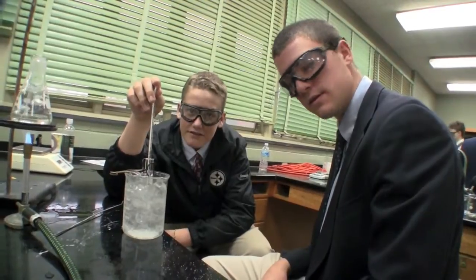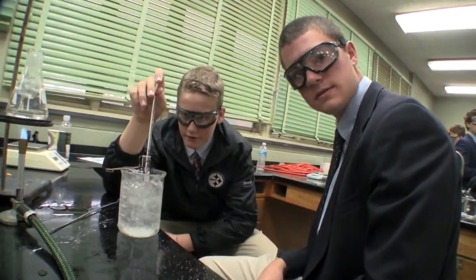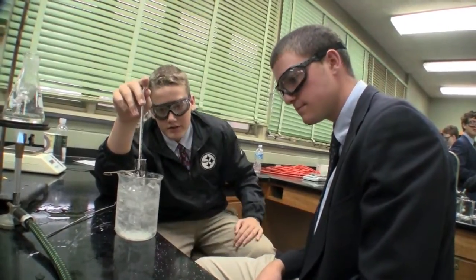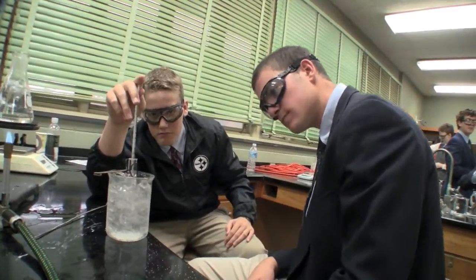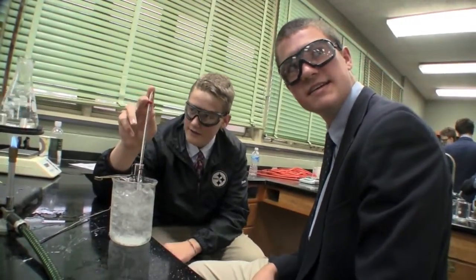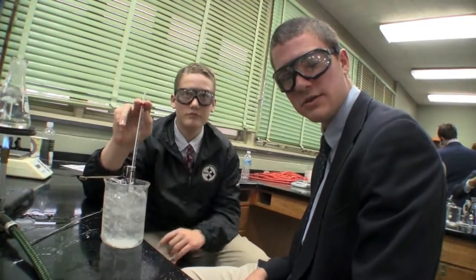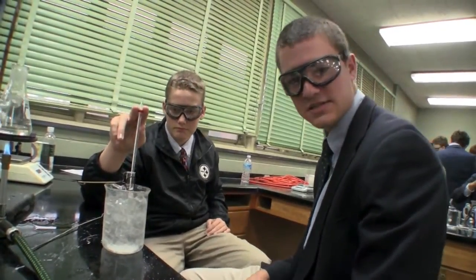And how many milliliters of water are you on? 10 milliliters of water. And how many grams of ammonium chloride? 2.6. What are you noticing so far in your experiment? The temperature that it has to be at for the ammonium chloride to solidify is dropping drastically.